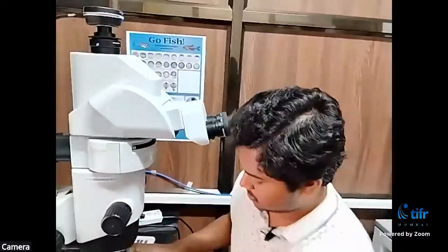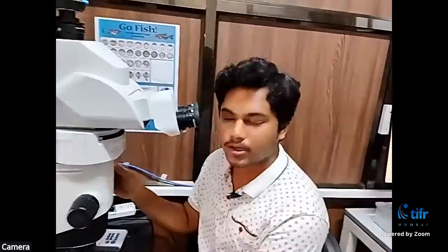So you have a technique called in situ hybridization, by which you are able to mark a tissue so that it can be observed. And why is it called so? In situ hybrid, is it related to some process? Yeah. So in situ means in the embryo, in the whole embryo. We are not taking a particular tissue or something. Yeah, the embryo is actually dead, but still it is inside the intact embryo. Okay. So I'll be explaining the procedure.